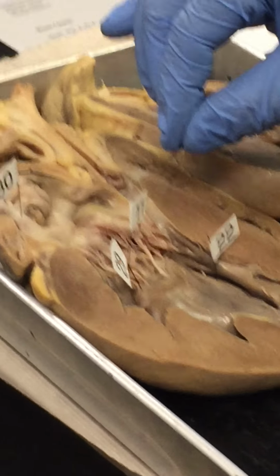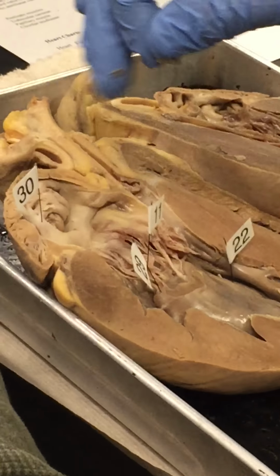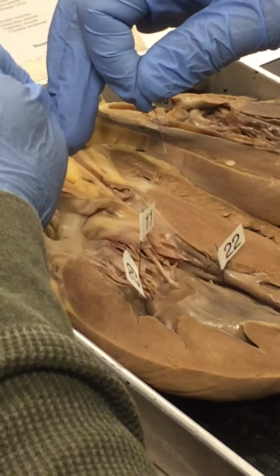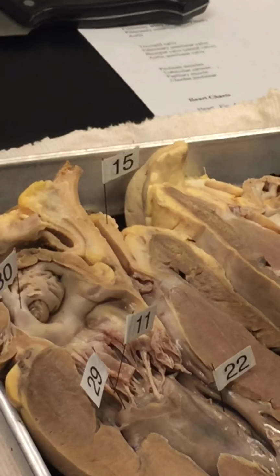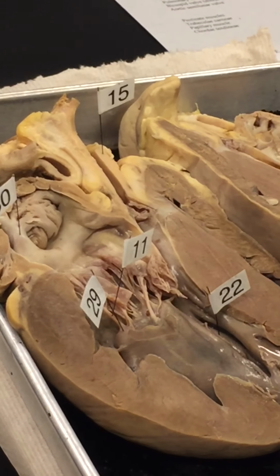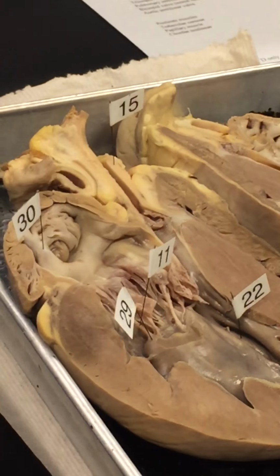Now I'm going to put this in a couple other valves. Coming out of the left ventricle is this large vessel, the largest artery of the body, with very thick walls, and that's the aorta. We'll just call it aorta on this dissection. When it first comes up, it's the ascending aorta, then it becomes the aortic arch, and it becomes the descending aorta, the thoracic aorta.